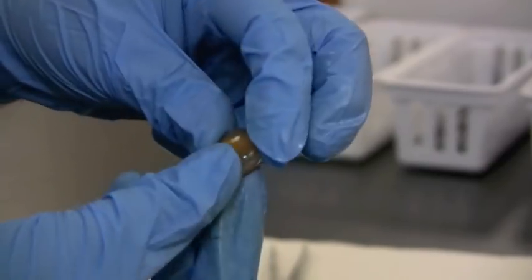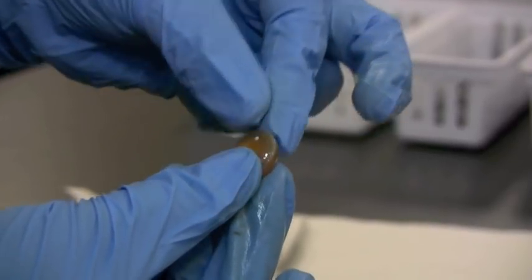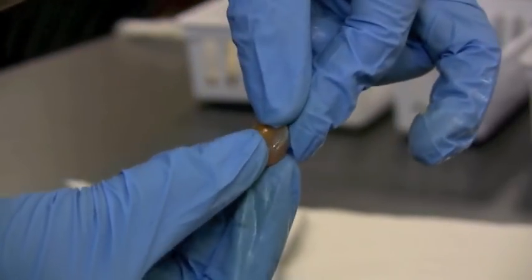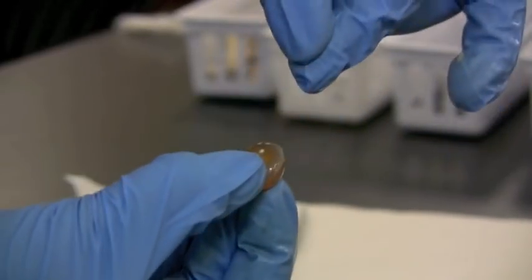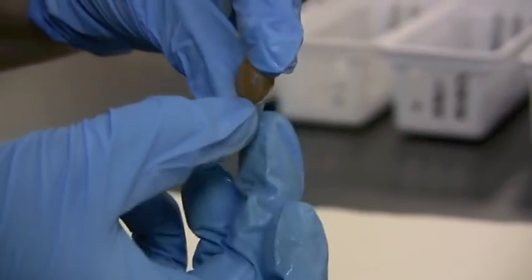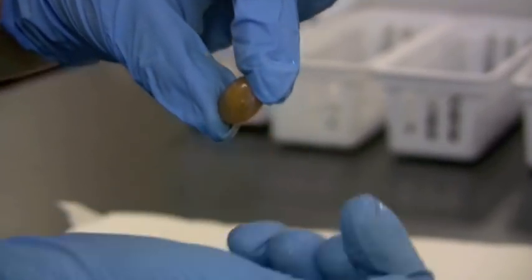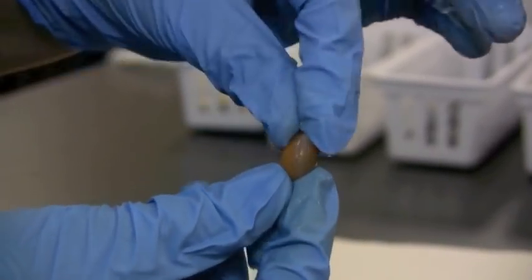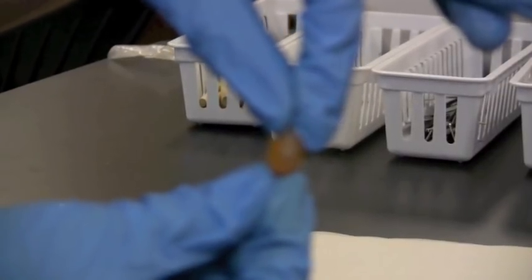It wasn't always that hard. It was a lot more pliable, filled with crystalline proteins. And it would be, you can pull on it all around the edges of the circle to flatten it out or have it bulge into this more round shape so that you could focus a little bit better. The light coming in, the lens would accommodate by changing its shape, the ciliary body is going to pull on that.